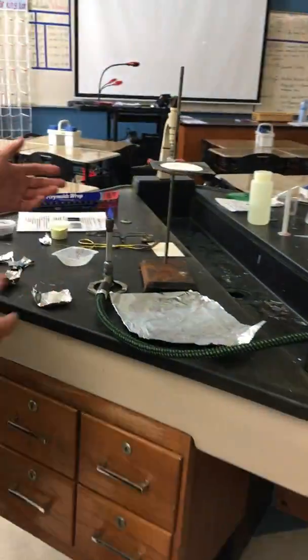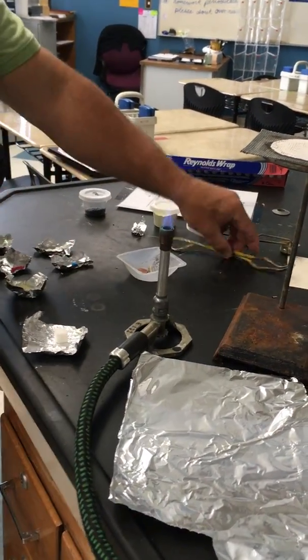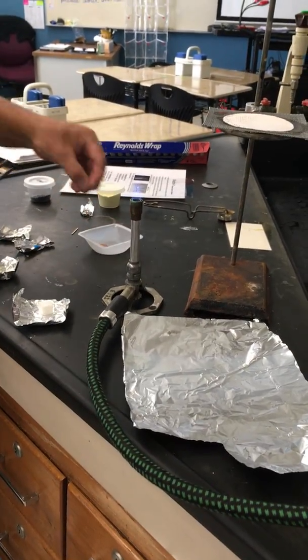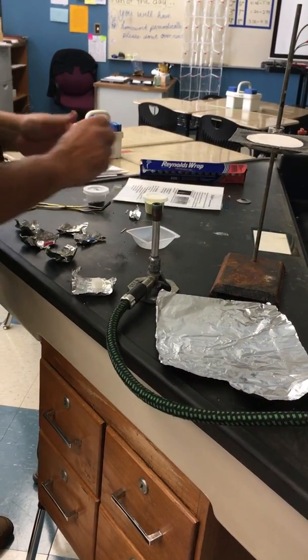All right, we're going to go to our last one in our fun station. One thing we learned how to do is light the Bunsen burner, and you're going to have to learn to do this yourself, but that's not the purpose of this one. All right, what we're gonna do is heat some things directly and you tell me what happens. So the first thing is a strip of magnesium. And again, I'm gonna light directly in the burner. Except the burner, I cut it off.